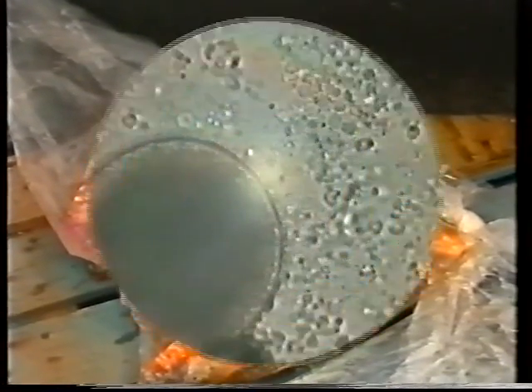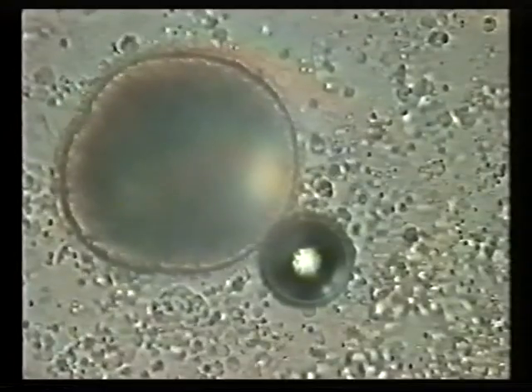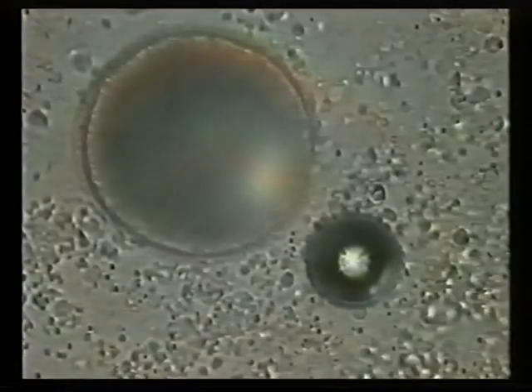It is easy to understand how a fish can soon become debilitated with such speed of reproduction, and will definitely end in multiple fish mortalities. Therefore, it is essential to deal with this parasite as soon as it is identified. If young swarmers fail to find a host within about 24 hours, they will die.